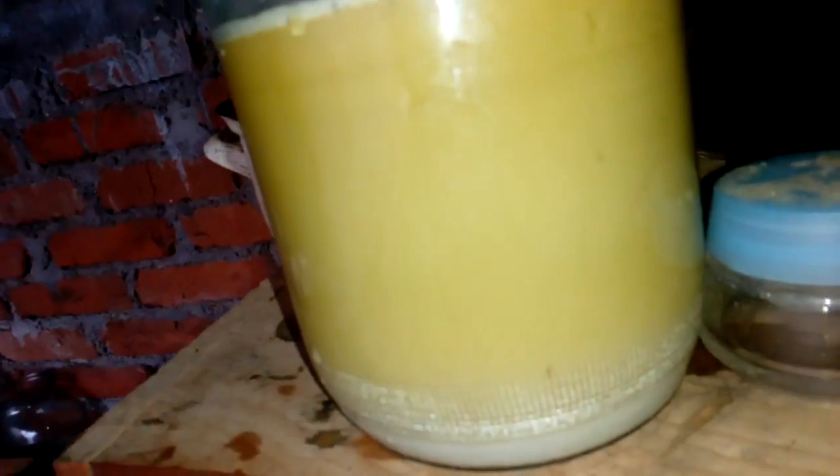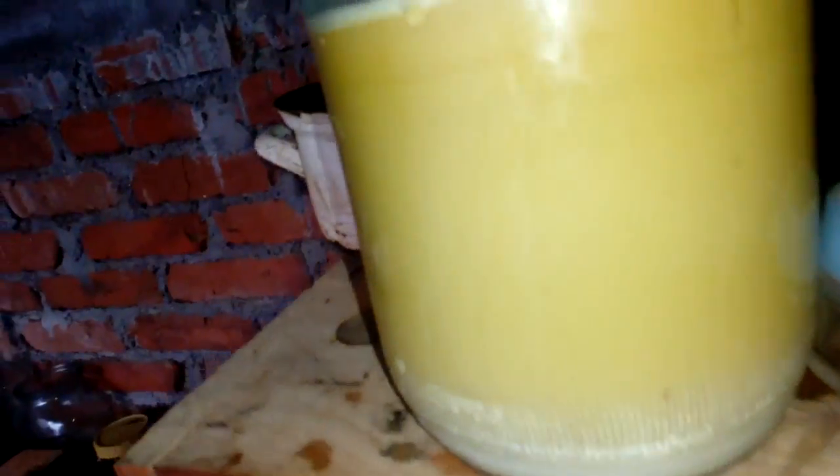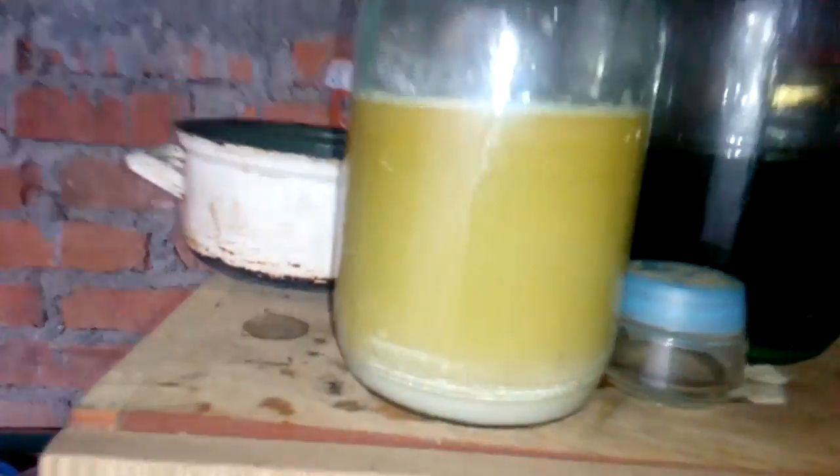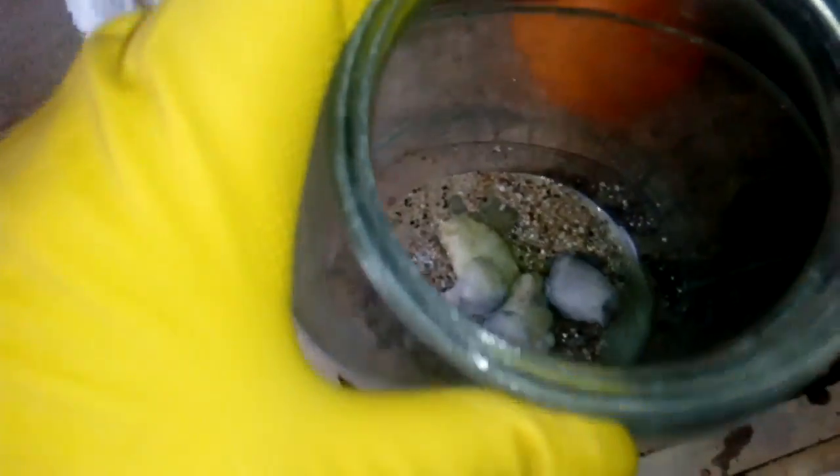But nevermind, when I filter that silver, I drop that palladium from that solution. Okay, and now we will add some aqua regia here to dissolve any left palladium which is on ceramic.